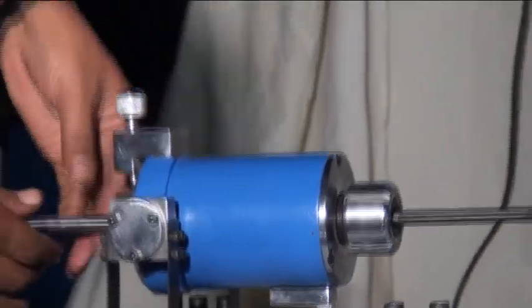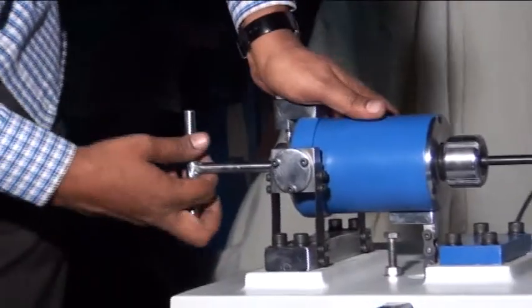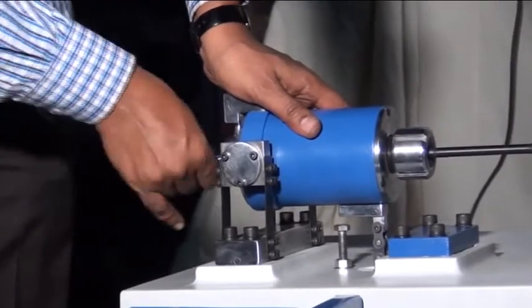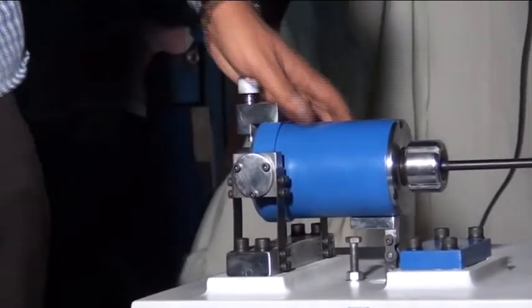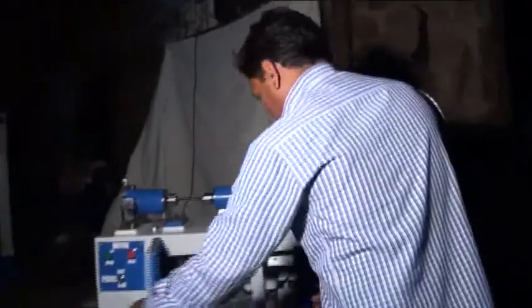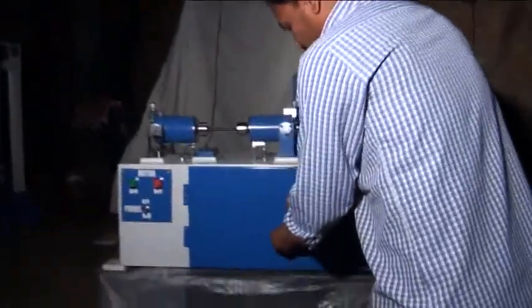Once this is completed, remove this. After removing it, set the knob here and close the tower.